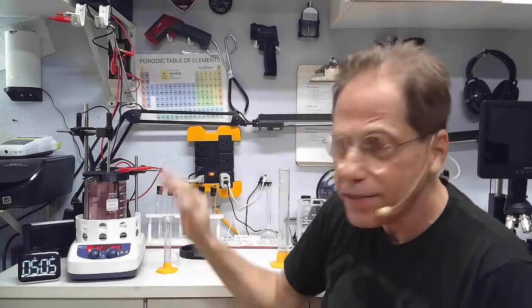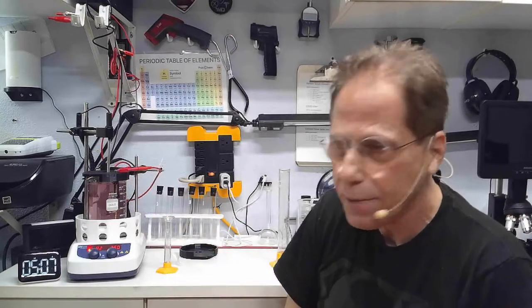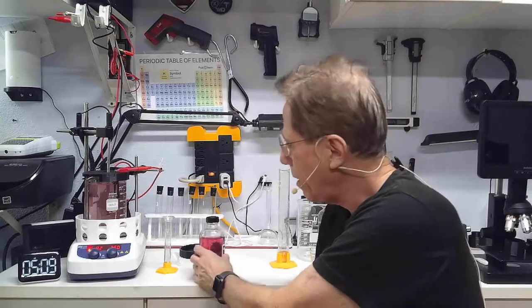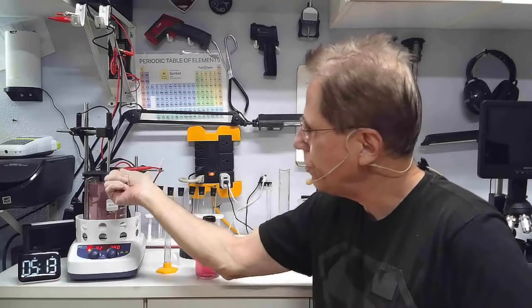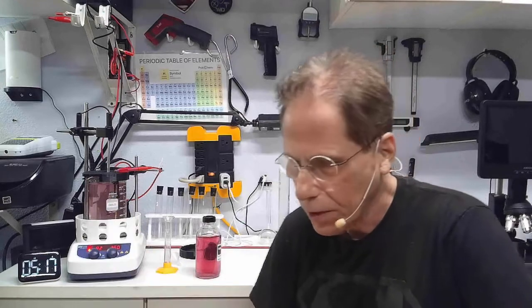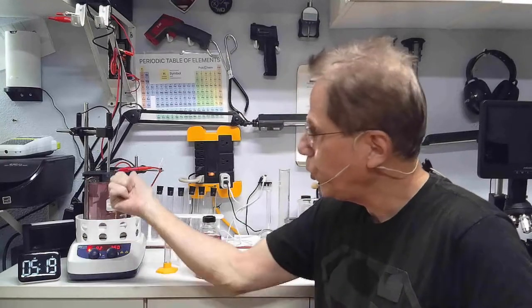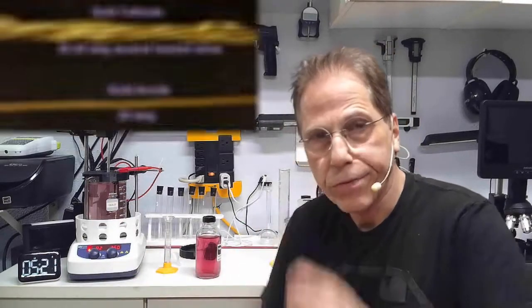What I did in order to get my 20-minute figure down was I would let it get a little bit darker like this, and then I would turn off the power. I'd leave it for 10 minutes and see what color it finally stabilized on. Then, having a three-digit scale, I would measure the weight of my gold rod.